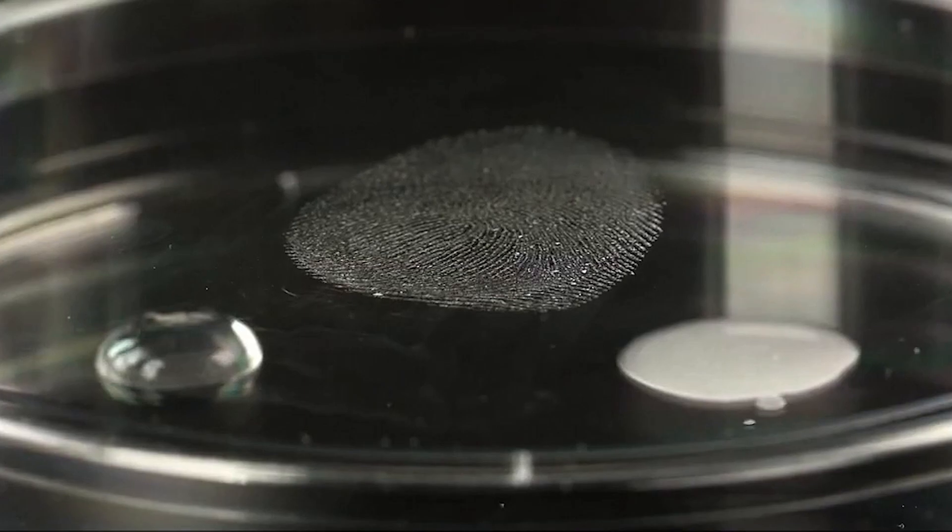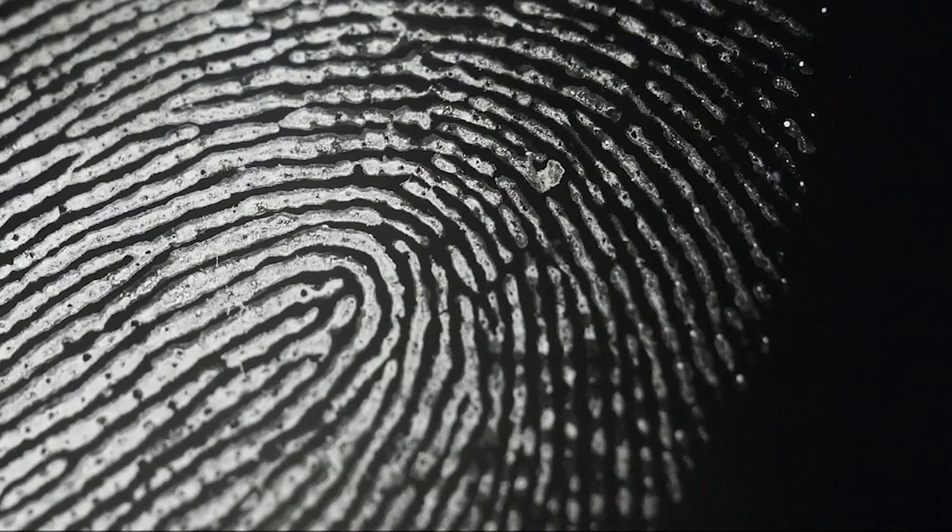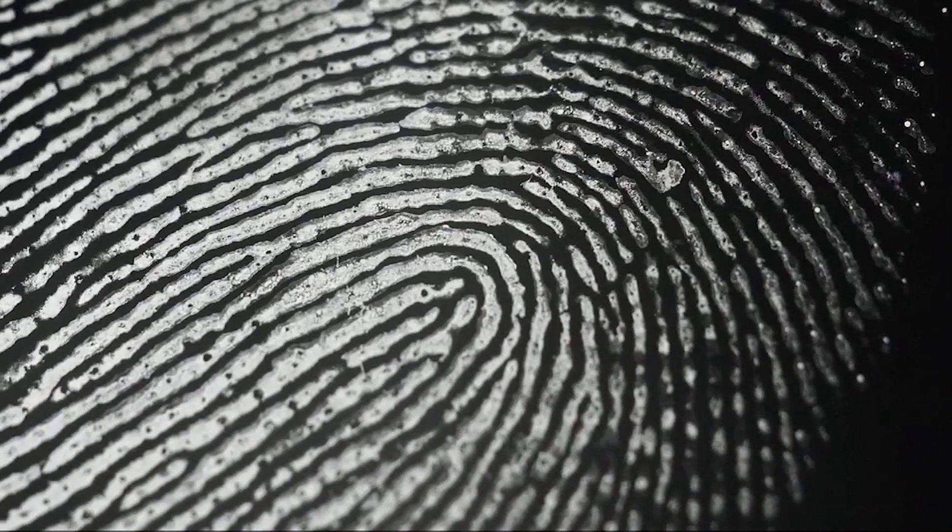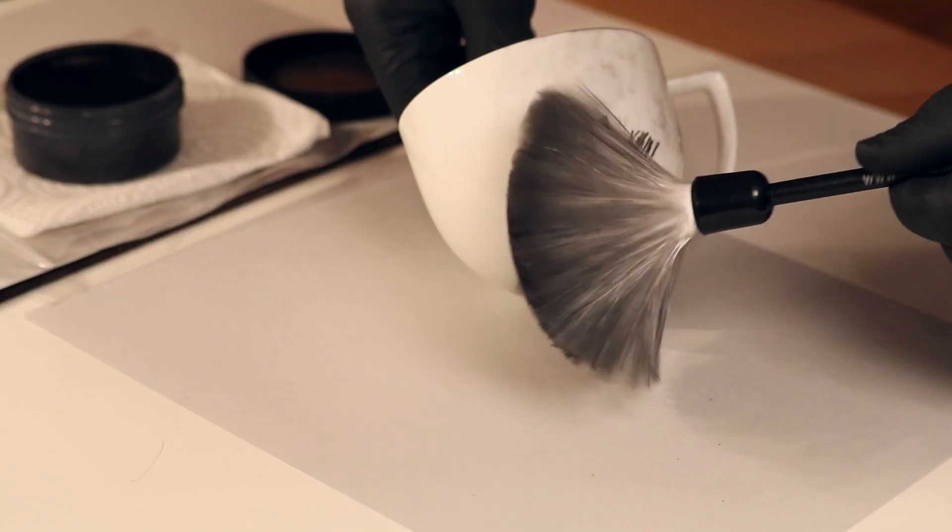Cyanoacrylate fuming is a non-destructive way to develop latent fingerprints where the prints can be lifted multiple times. It can be useful when lifting prints from delicate items or when the prints cannot be lifted using traditional means.